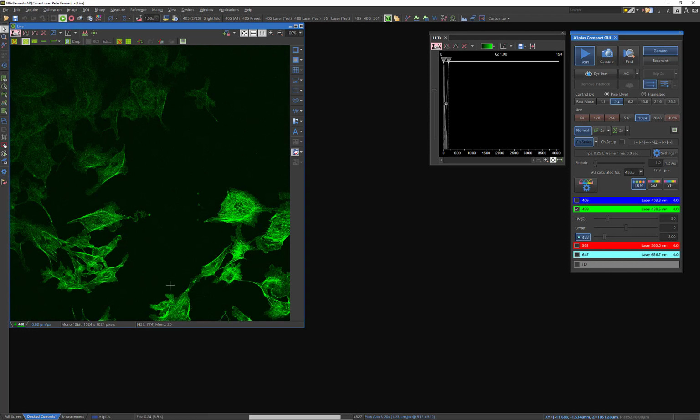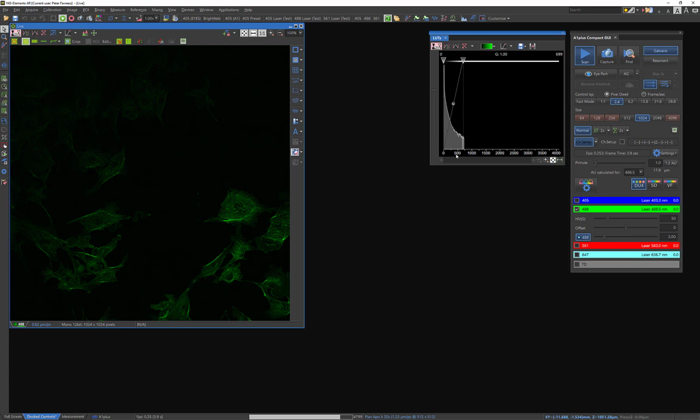You can see immediately I see a much brighter signal here. But as you can see, I have not yet reached the 2000 mark. So I'm going to increase these again to something maybe a little bit less of a jump. I'm going to go up to, let's say, 70.